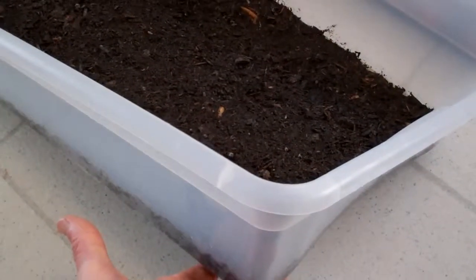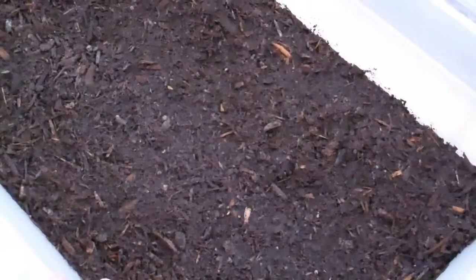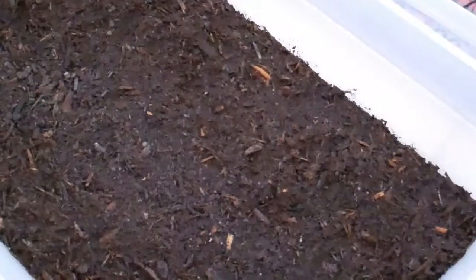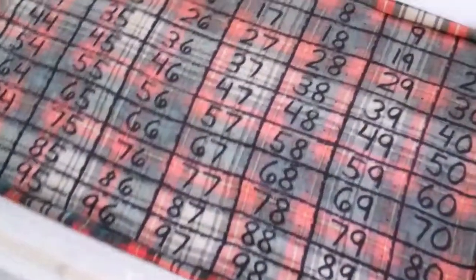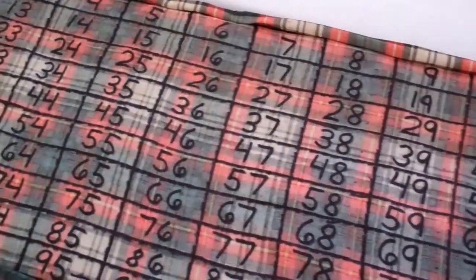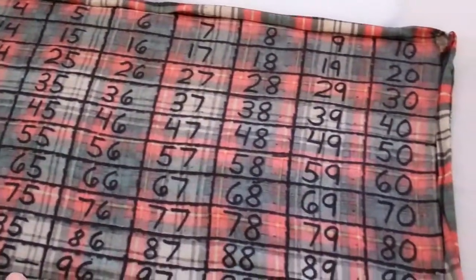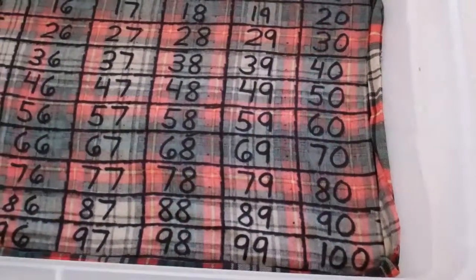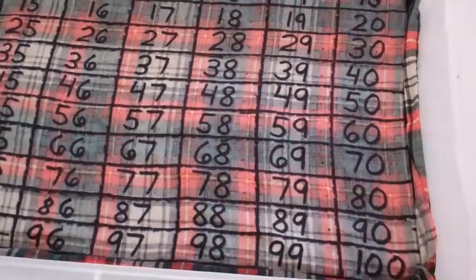I've got a polyethylene storage box here, filled with a potting medium about an inch deep, which is moistened, and I'm going to use this as my germination box. It's about three feet by one foot or so and should hold seeds for about a hundred ears. Over top of the potting medium, I have some cloth cut and marked with permanent marker with rectangles, where seeds for each of the respective ears from packets will go to be germ tested. I have three boxes, so I can test 300 ears at a time.